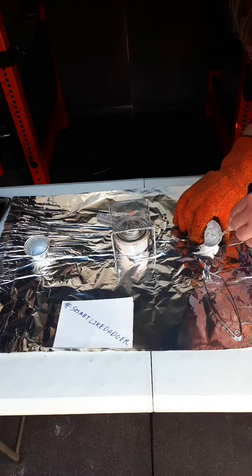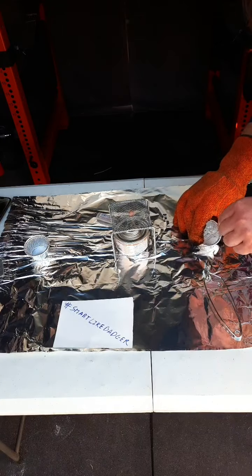So Boris, looking at this, thinks he sees a little brown, a little change in color. And Boris doesn't want to change the color. You just want to boil off the water. You don't want to melt it or have it react with oxygen in the atmosphere.